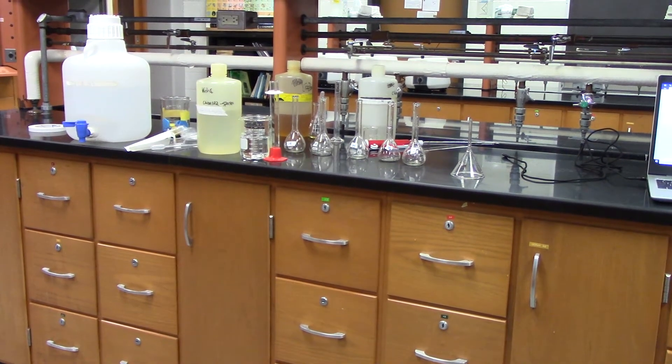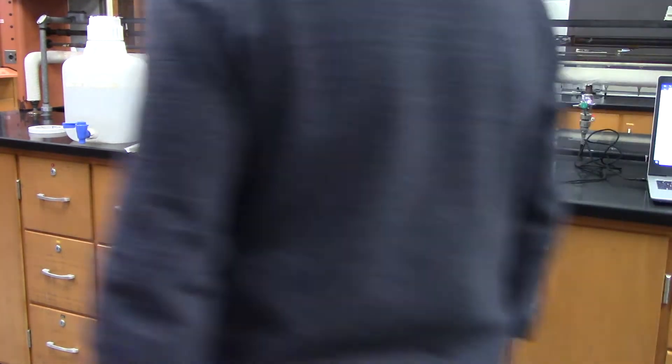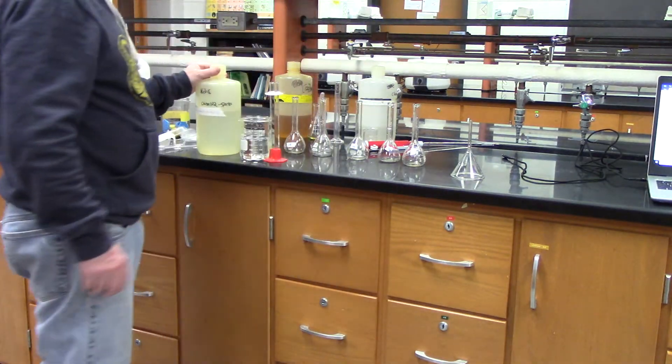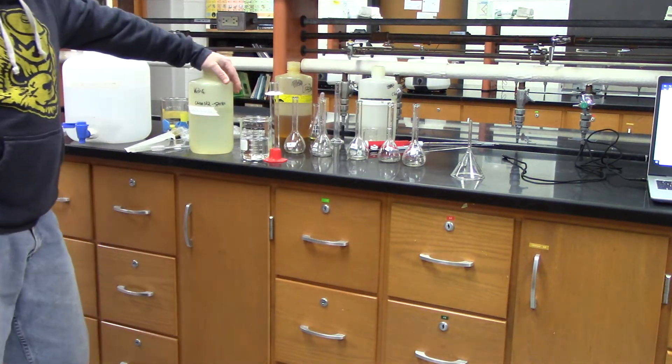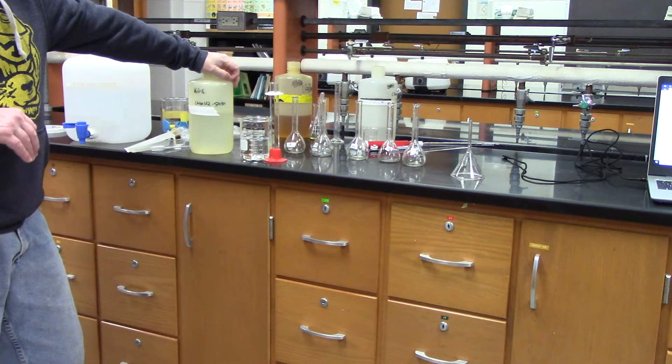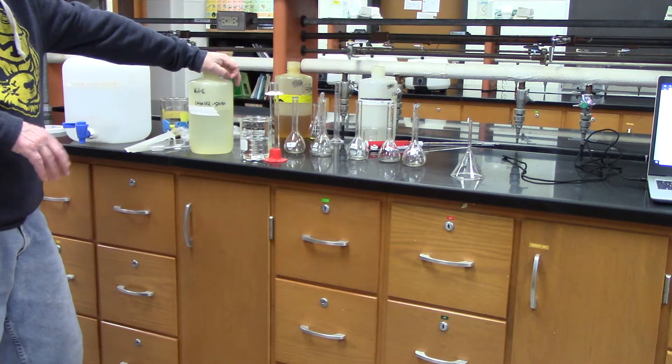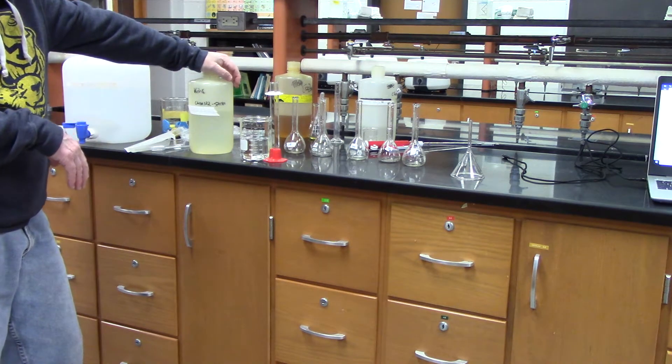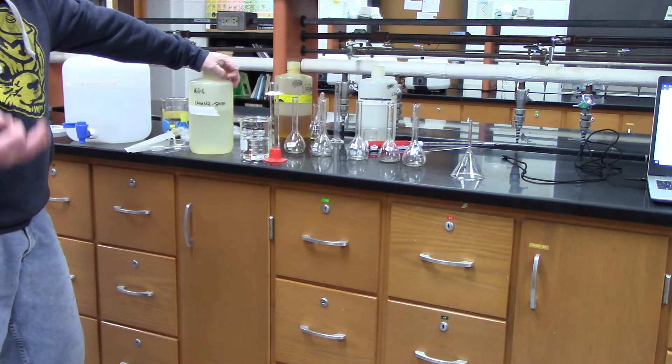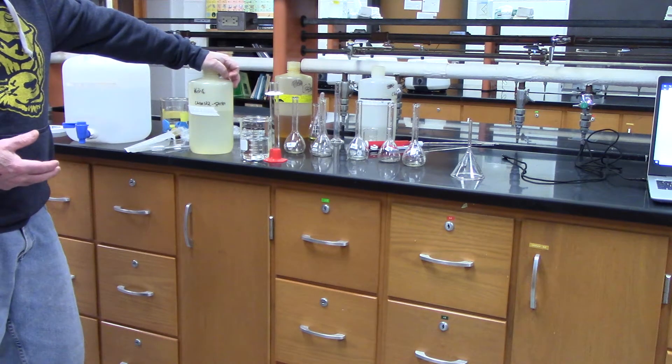Okay, so the next part of this is actually to do the experiment. I'm going to make five more solutions. Typically when we do these experiments, we just do what the experiment's procedure says, and then we'll analyze the data after we do the experiment.